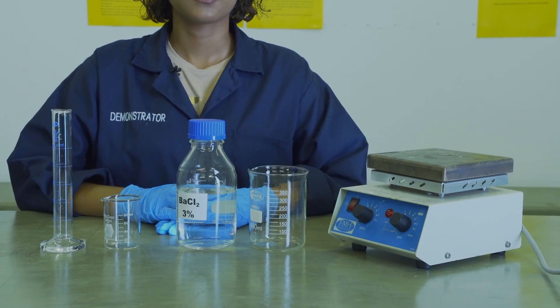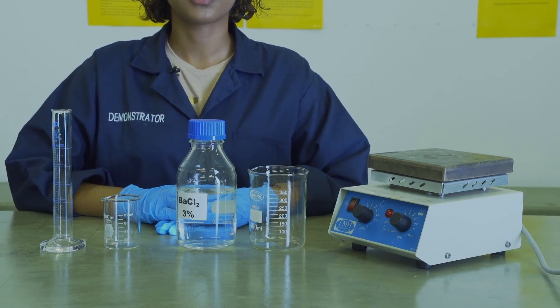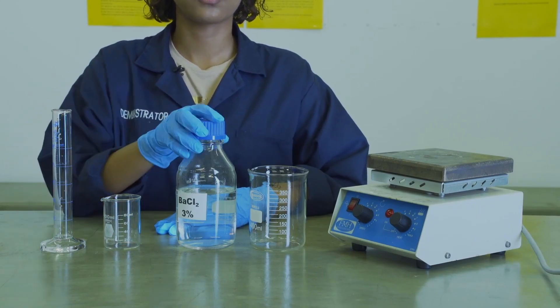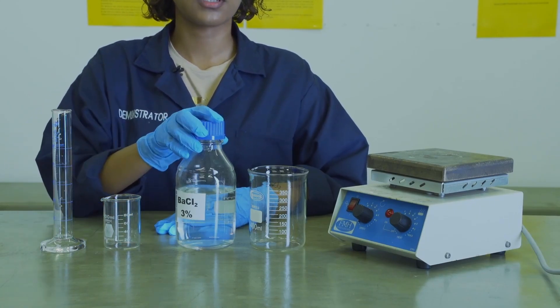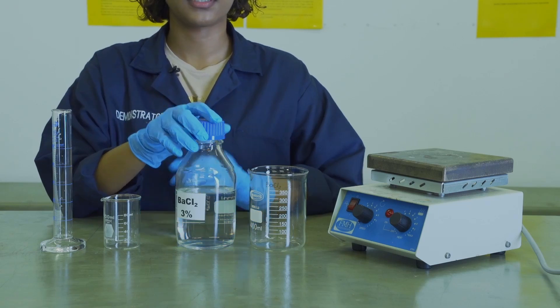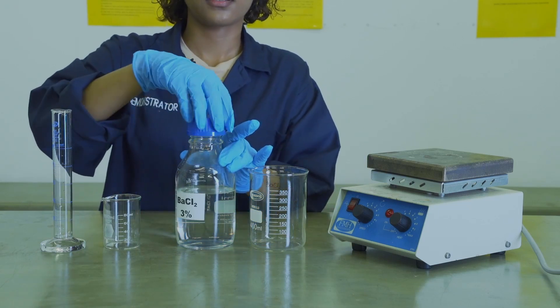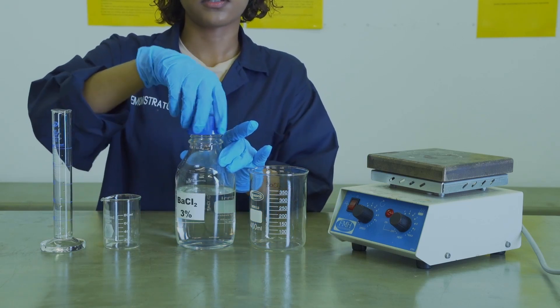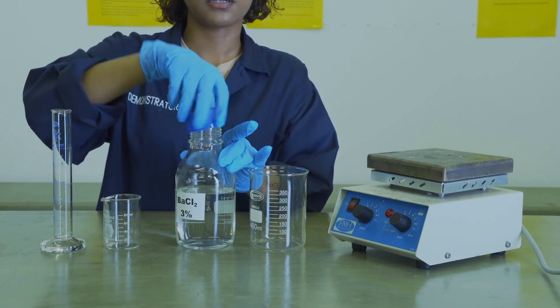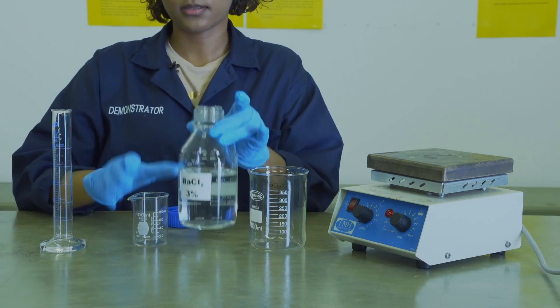In the next part of the experiment, we are going to add 100 ml of barium chloride solution and we are going to heat this to near boiling. To make this easier to transfer, we are going to add it to a beaker before adding it to the measuring cylinder.